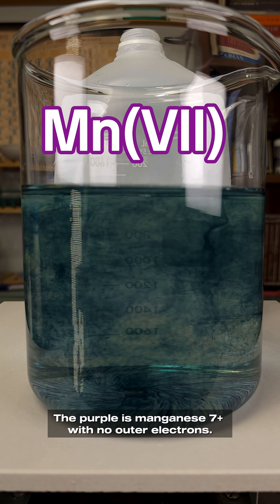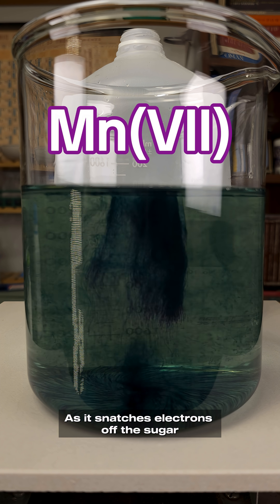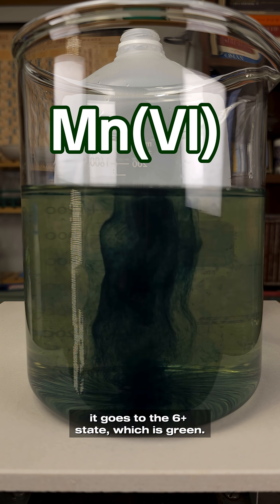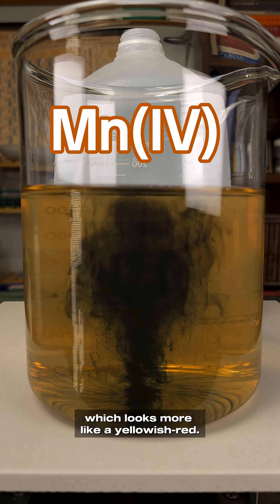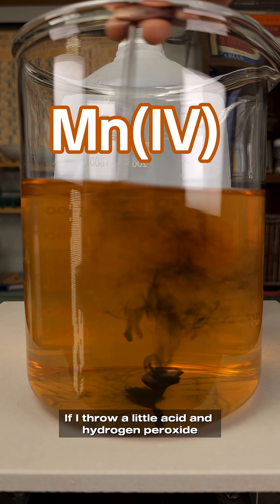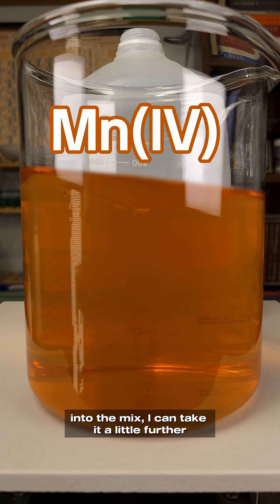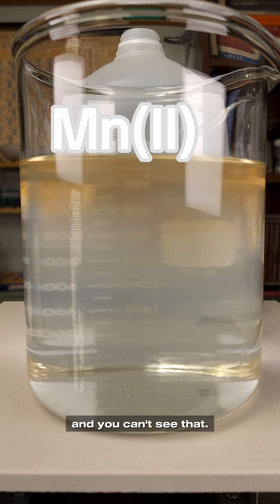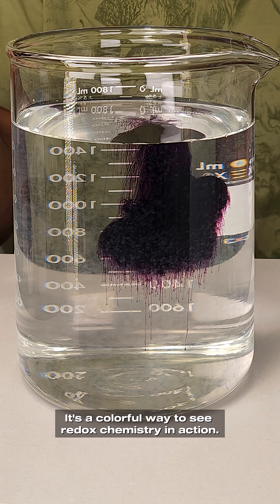The purple is manganese 7+ with no outer electrons. And as it snatches electrons off the sugar, it goes to the 6+ state, which is green. And then it starts to go to the 4+ state, which looks more like a yellowish red. If I throw a little acid and hydrogen peroxide into the mix, I can take it a little further and drop it down to the 2+ state. And you can't see that. It's a colorful way to see redox chemistry in action.